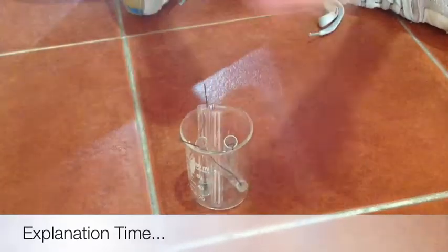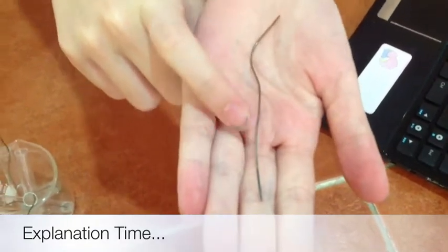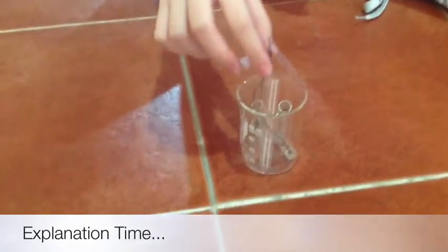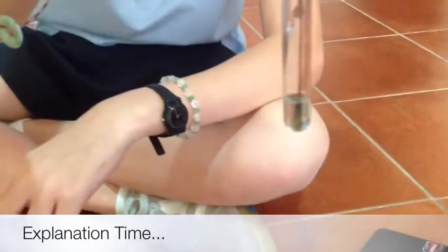So it's like this example of the copper wire here, where the colour at the end is a little silver — you can see it — compared to the rest, the top of the copper wire, where it's brownish. This experiment shows us a clear sign of a single displacement reaction taking place between the silver nitrate and the copper wire, which results in the chemical equation: AgNO3 + Cu → Cu(NO3)2 + Ag.